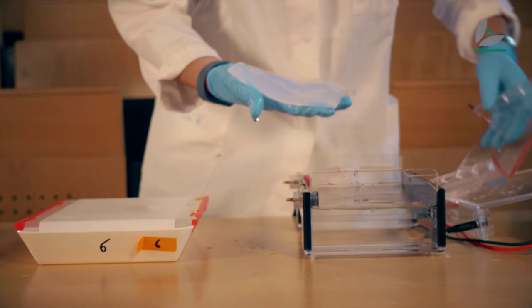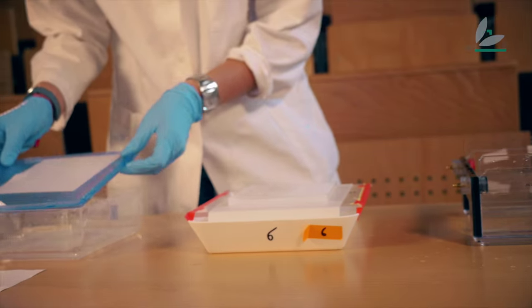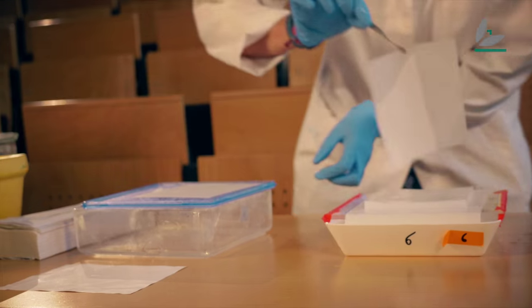So I'm going to put the gel on this paper and I'm going to put a foil on top of it. It's very important that there are no air bubbles between them.